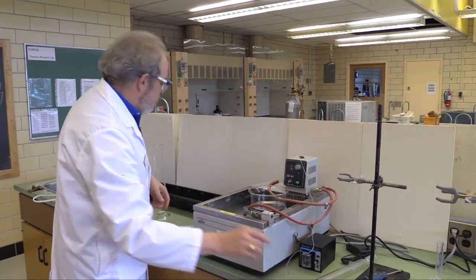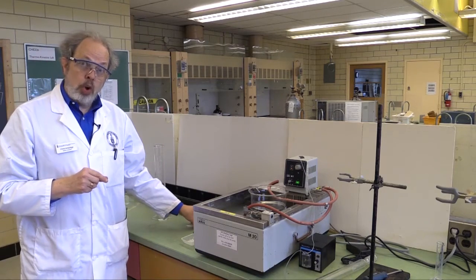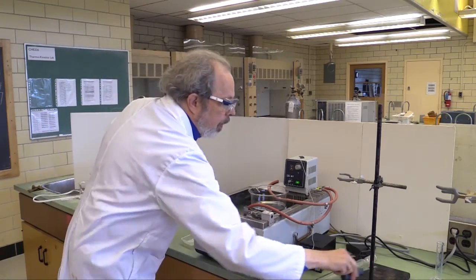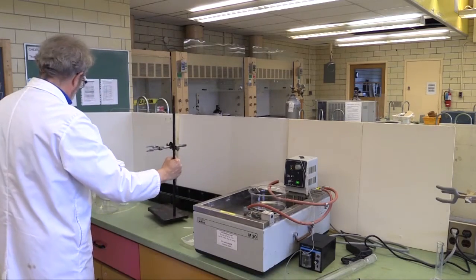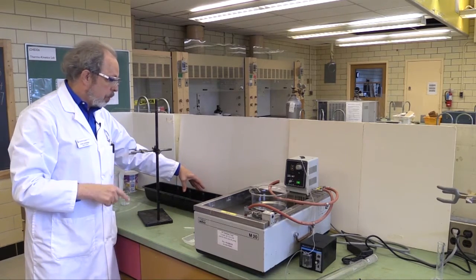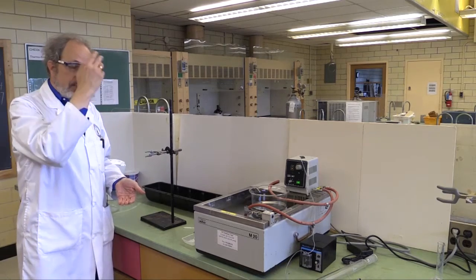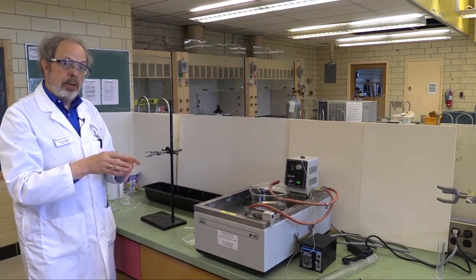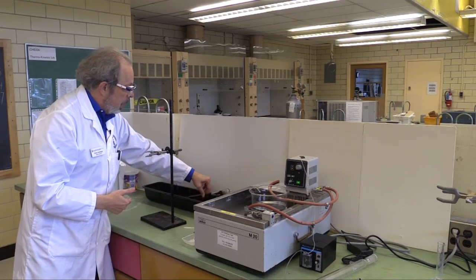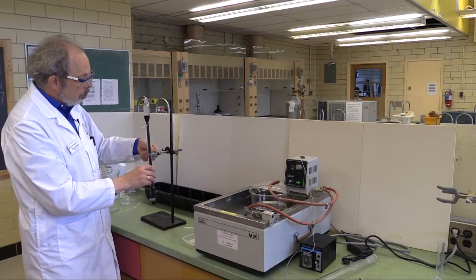Putting that to one side, because the actual packing process takes a while, we have provided you with one that is already packed, and then you're going to pack another one for the second half of the reaction. The reactor that's already prepared is actually in this trough. It's stayed underwater. One of the problems that we have is the reactor bed needs to stay wet all the time. If you let it drain out, you get pockets of air in it, which can really badly interfere with the way the liquid flows through it.